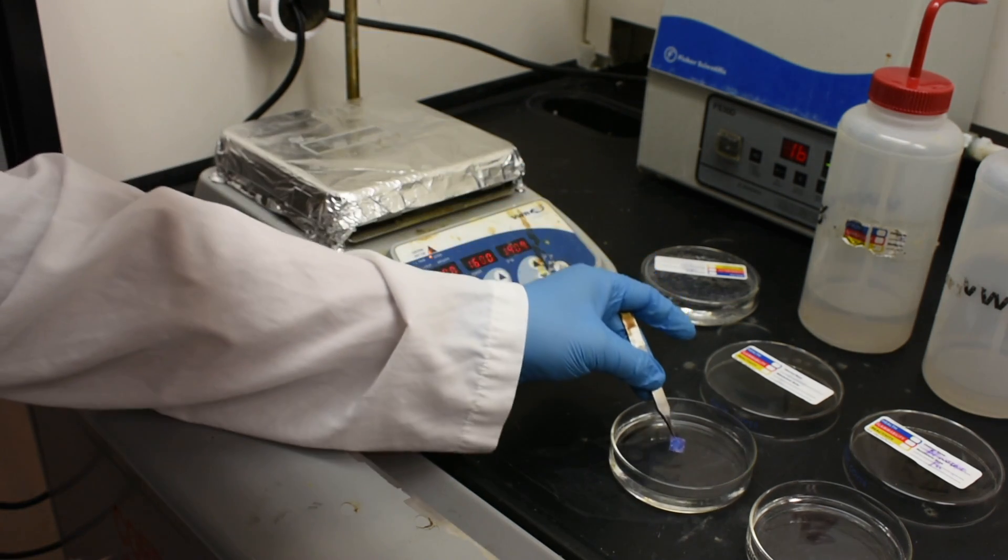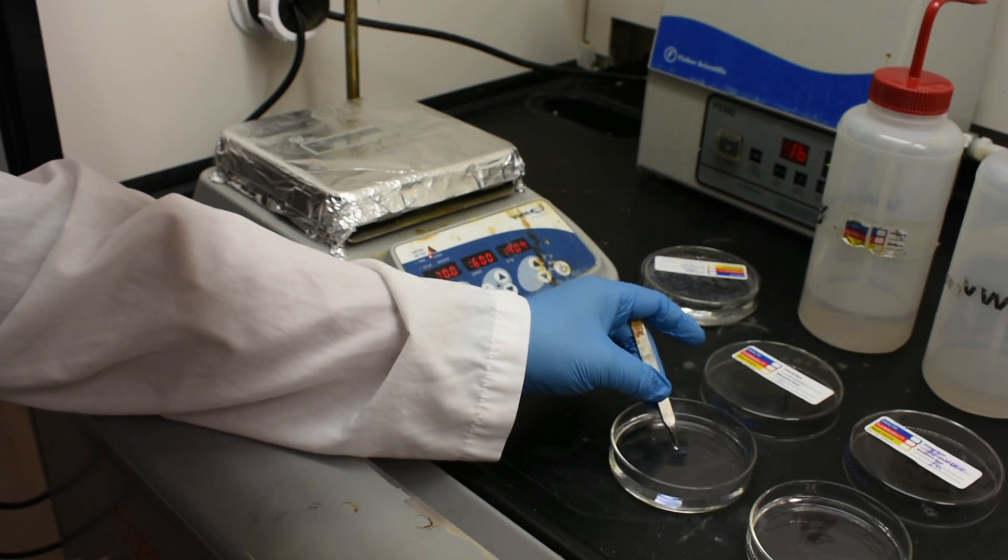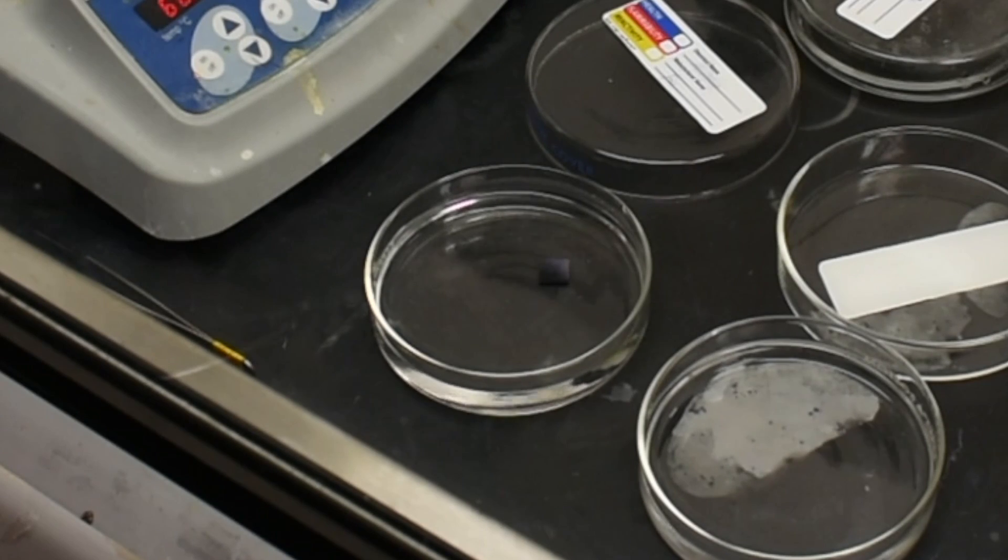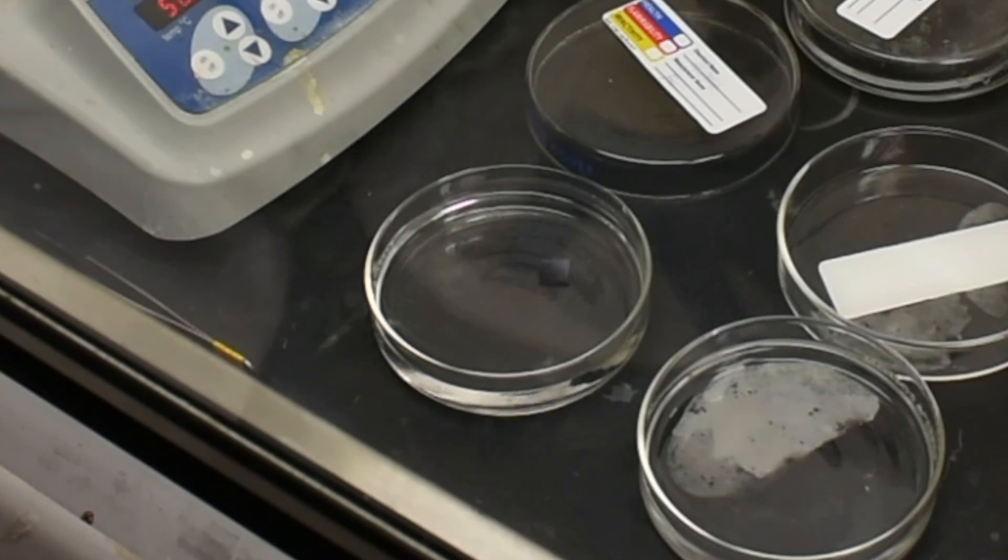For some samples, a thicker PMMA layer is used. In this case, the samples are left in the acetone bath overnight.